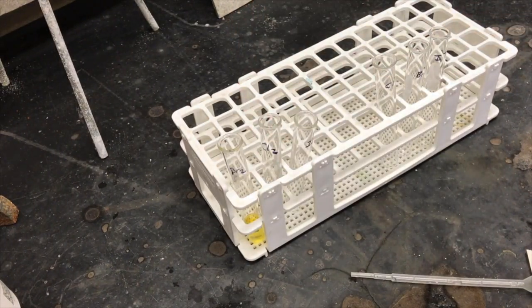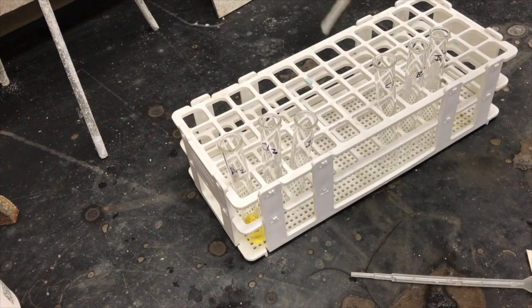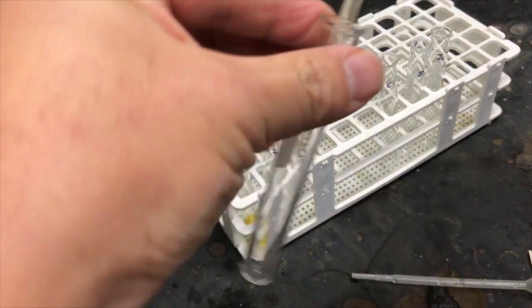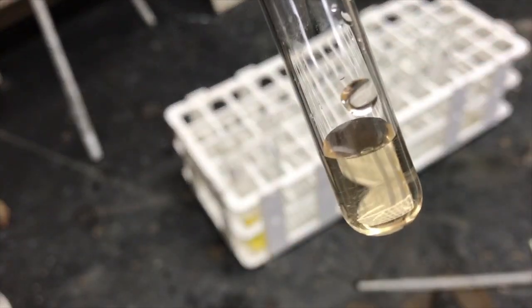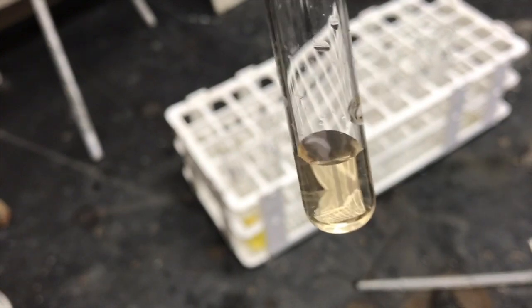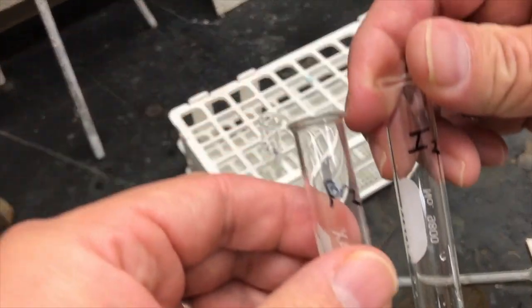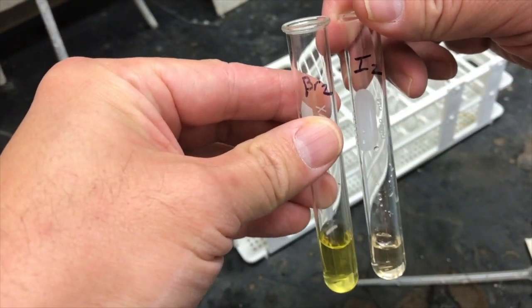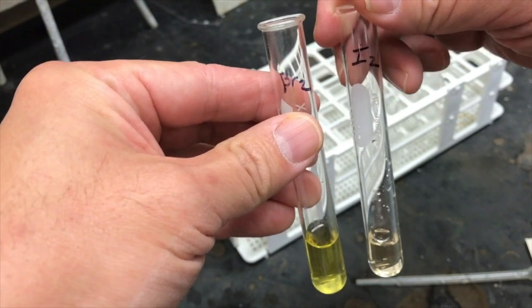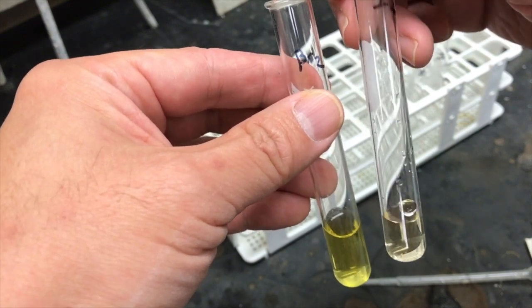The iodine has kind of an amberish, orangish color. So compare these two together. They both have, it would be inaccurate to call them both yellow because we would need some way to distinguish them. So the bromine here is kind of a brighter yellow whereas the iodine is more of an orange or yellow.